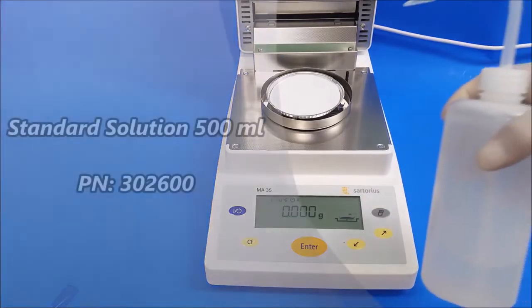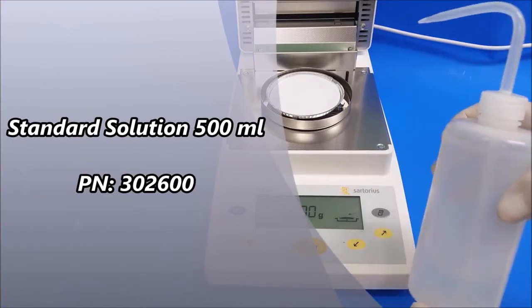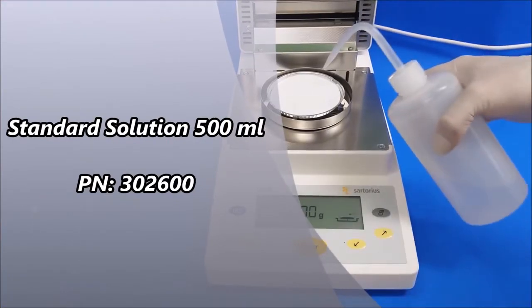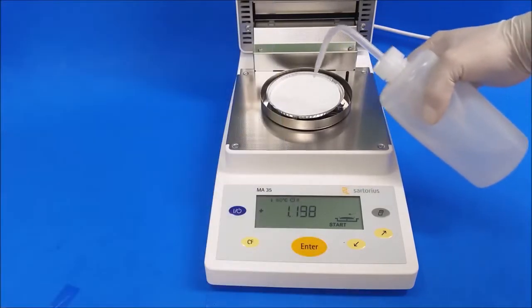I'm going to add standard solution. There's our liquid form that we have here. 2.5, that's what I add.